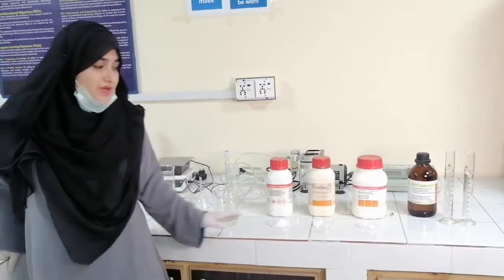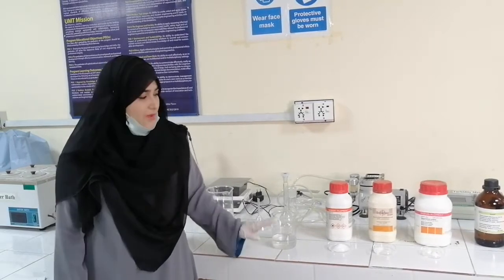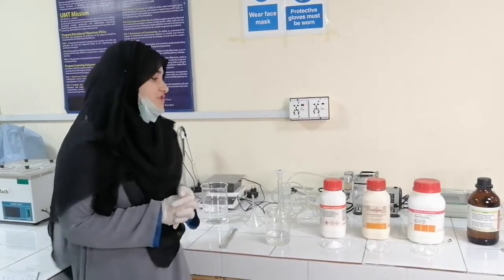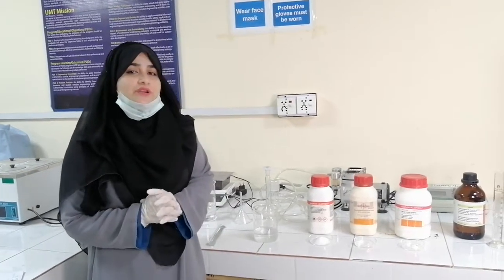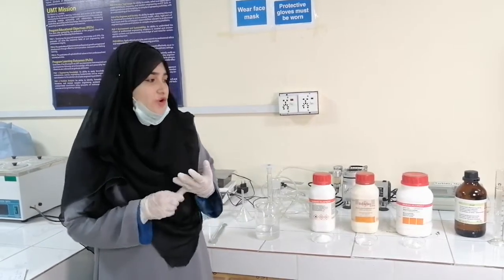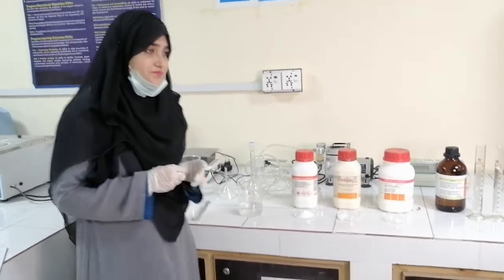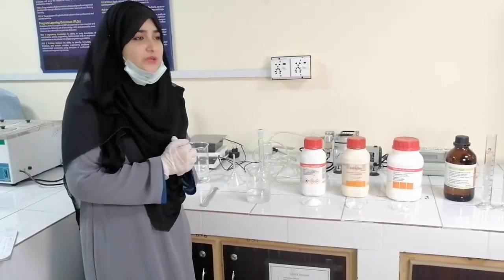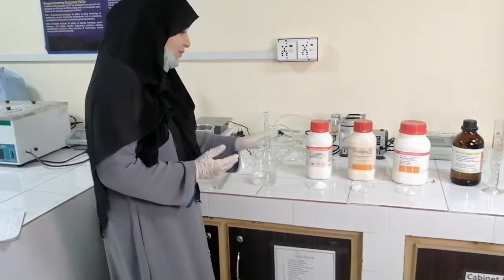Today we will measure the hardness. We will use EDTA titration to measure it. For this, we will require some reagents. I will show you the stages: first, an ammonia buffer solution, and then a 0.02 normal EDTA solution. We need to prepare the reagents and gather the chemicals and apparatus.